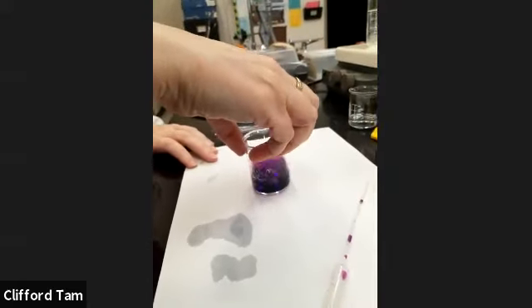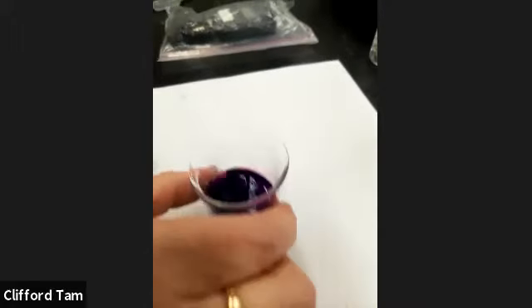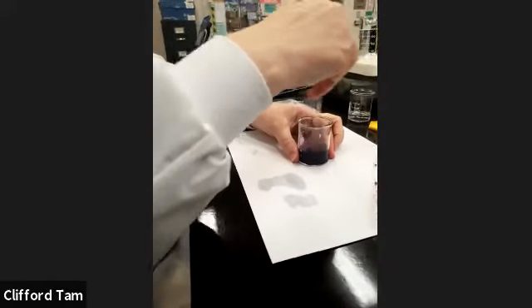Well, Xantha, this is wonderful. Overjoyed, because it's still very purple. Okay, I had a stirring rod right over here. Busting out that stirring rod. Let's go.